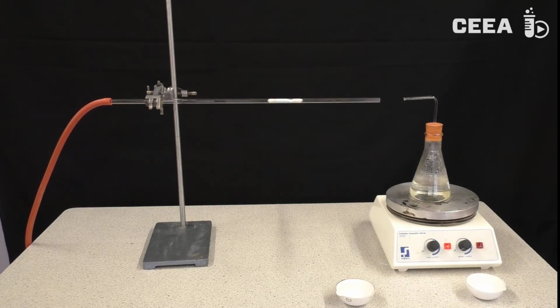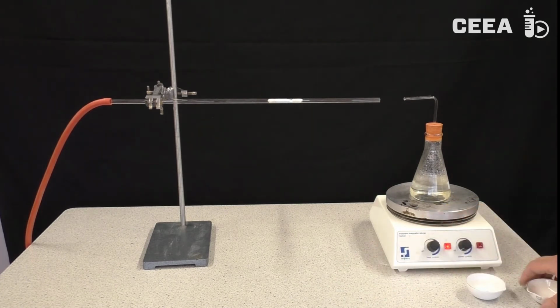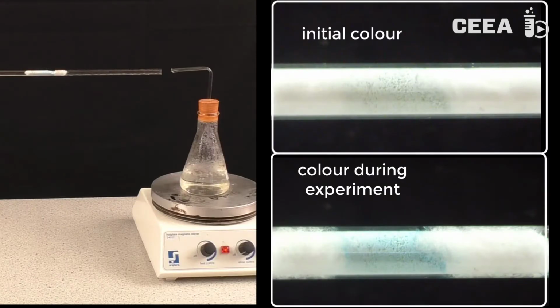Then water is heated in a flask and the water vapor is let through the anhydrous copper sulphate. As the experiment proceeds, we see the color of the sulphate turn into light blue. The video is somewhat speeded up. In the right part of the screen, we see 2 enlarged details. The conclusion is that water in gas flow can be detected by copper sulphate.